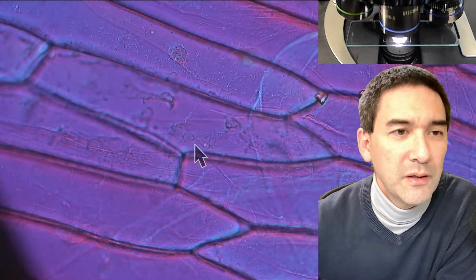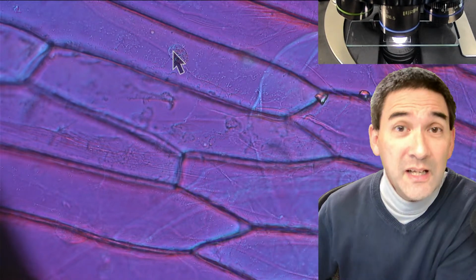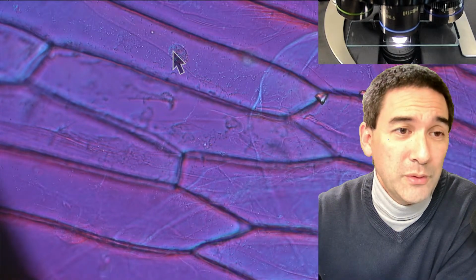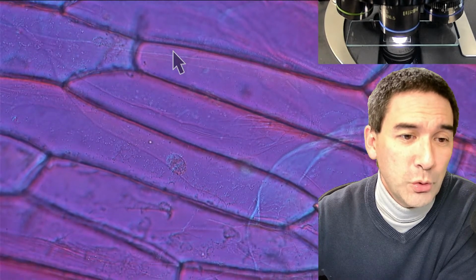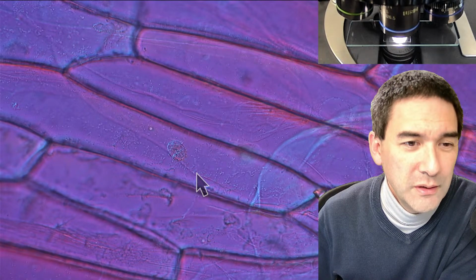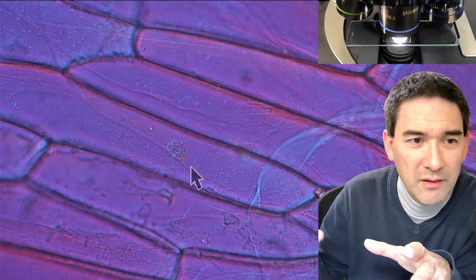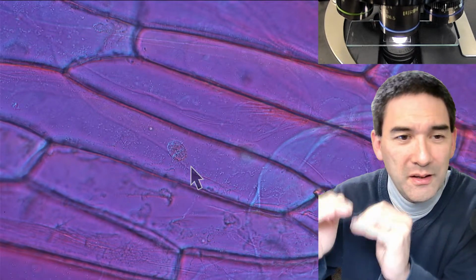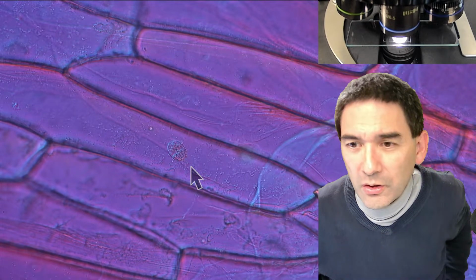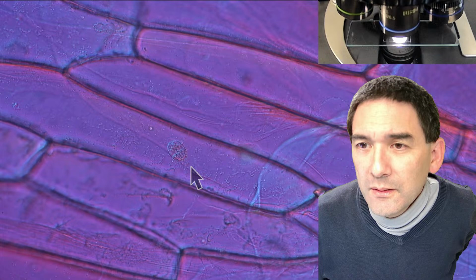Now sometimes you're able to see, look over here. It might seem that the nucleus is right in the middle, but it's not pressed to the side. Well, actually it is pressed to the side, either on the top or on the bottom, so it's still more on the side. But we're not able to see it on the side because we're looking at it from the top. If you look carefully, do you see all those little dots here? These are all the vesicles, and then the vacuole is found beneath it, so to say. Because the onion cell is transparent, everything looks like it's in one level. So just a quick answer to the question about the vacuole. Yeah, this was the one.